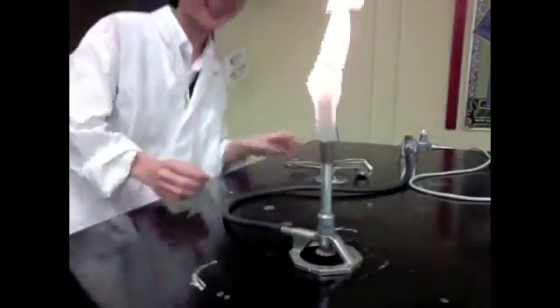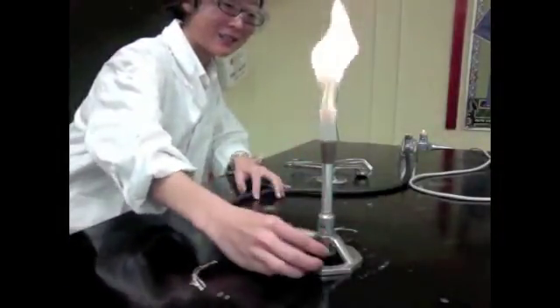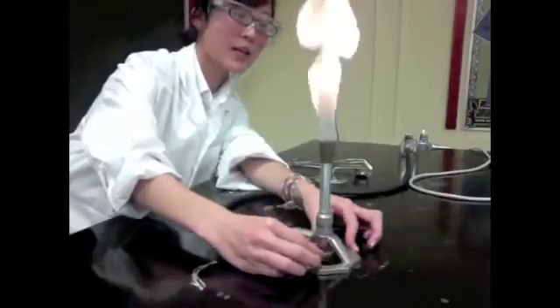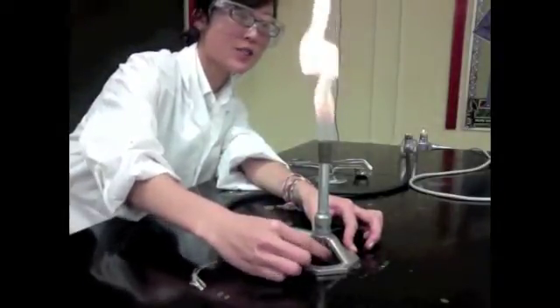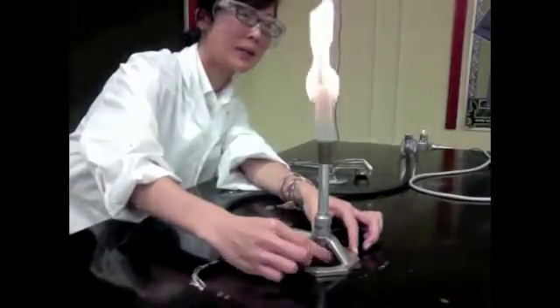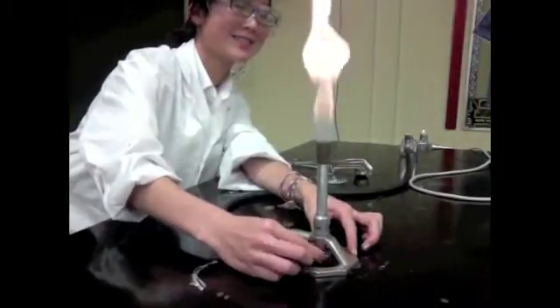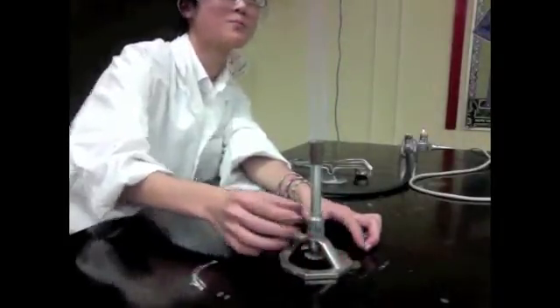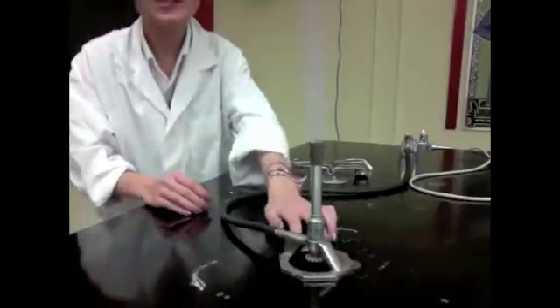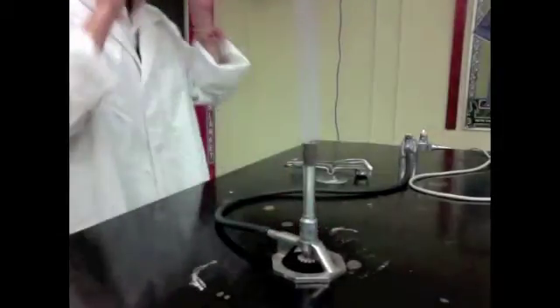That's a light flame. So we want to try to get a blue flame and we're just going to adjust the valves. So as you can see there's a blue flame. This means that the flame is hot enough for us to put the magnesium ribbon in.